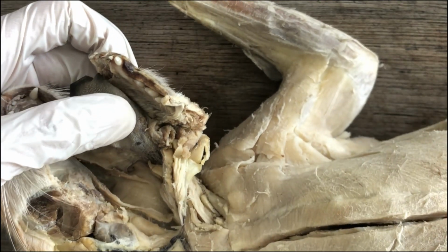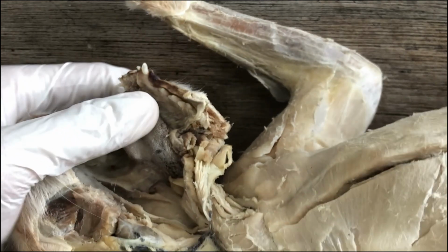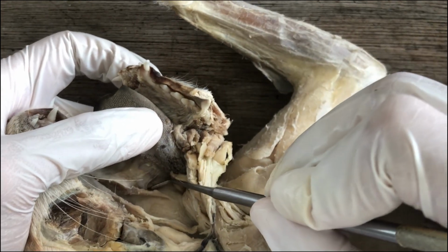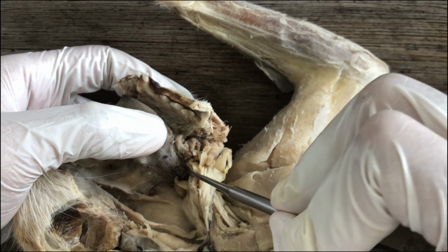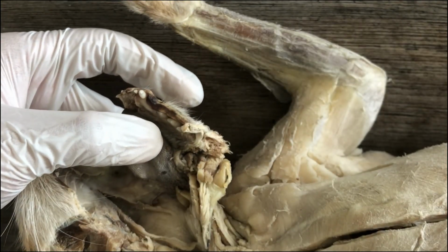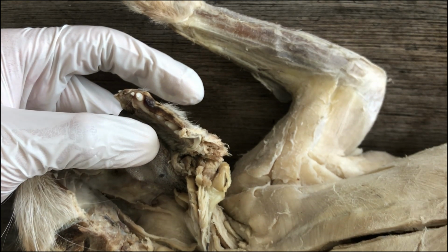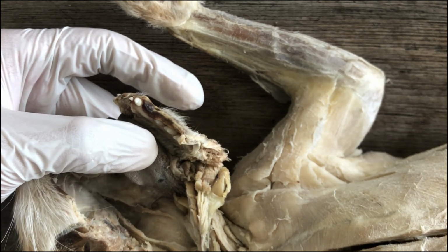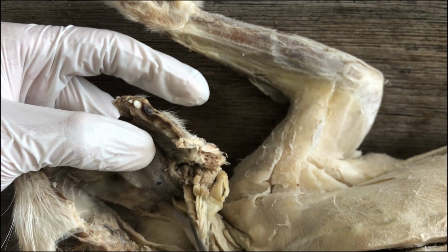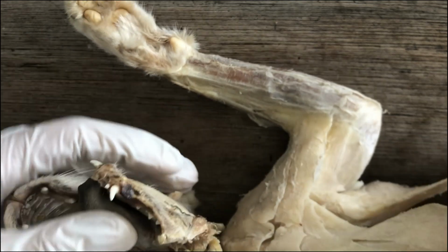And palatine tonsils are part of the immune system, first line of defense against infection. And the tonsil is actually bounded by two arches, which you can use as an anatomical landmark to delineate the boundary between the oral cavity and the oropharyngeal cavity, where the pharynx begins.